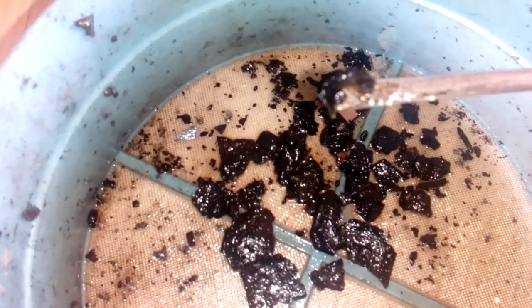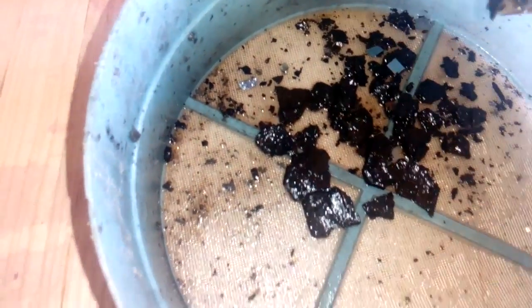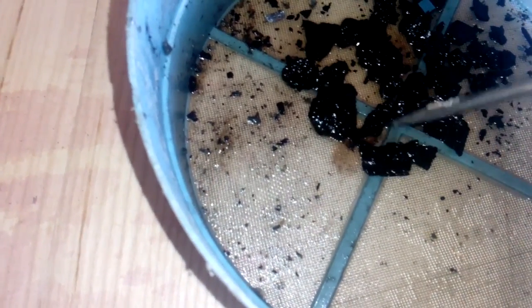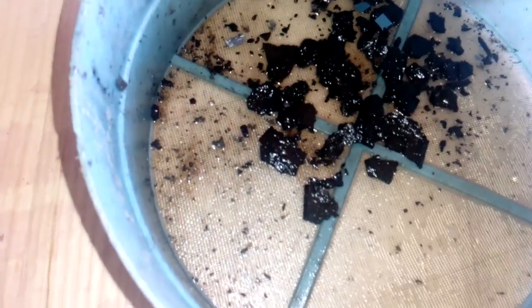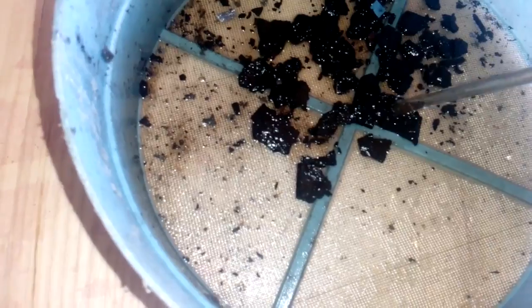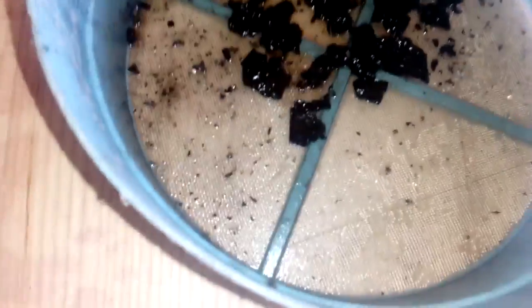You can see the exposed gold bonding wire. It just looks like I burned it with fire rather than wet ashing. It's overcooked or something. Definitely I now know that I cannot use car battery sulfuric acid for wet ashing. It's just not strong enough - even when you evaporate it down, it can't eat all that plastic material from BGA tops. And it would just make a bigger mess, because if you add aqua regia to these half-boiled chips, you'll just end up with some black aqua regia that's very hard to filter.